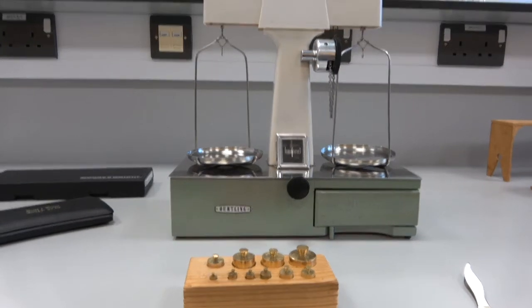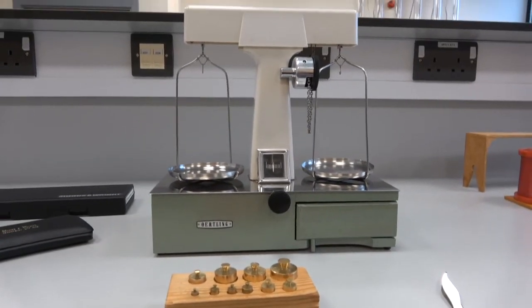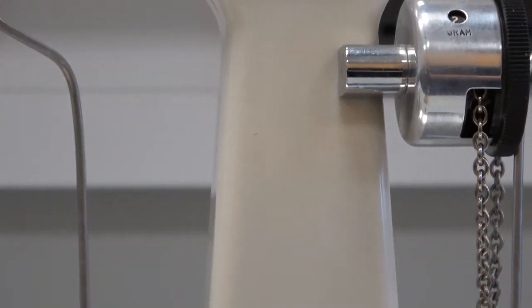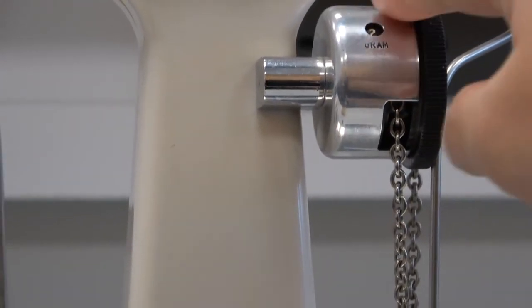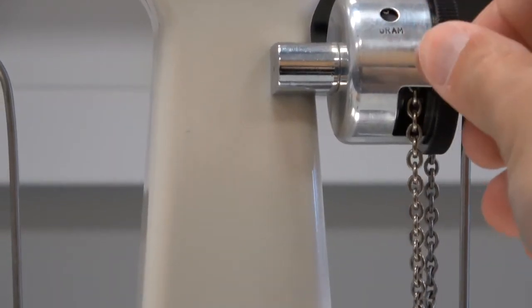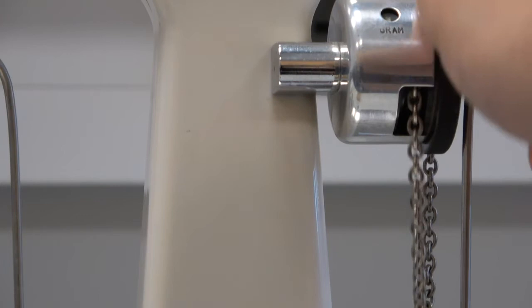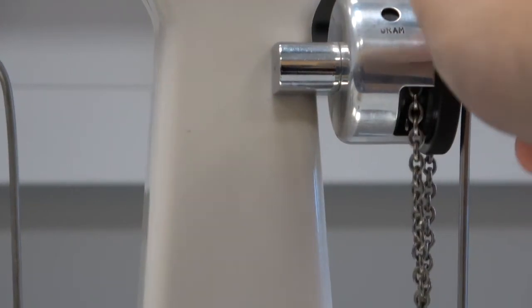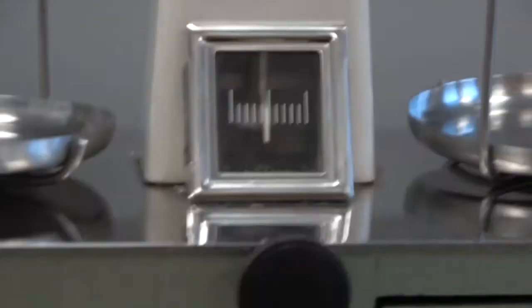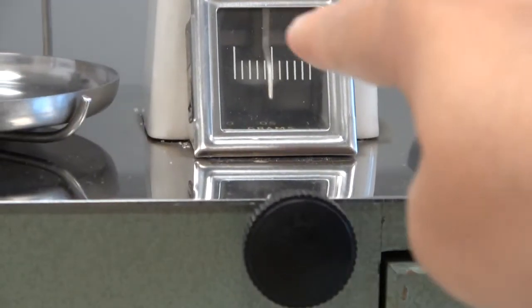Let's try a little fancy video magic here. So you can actually see, in this scale, you can see the increase in mass clicking up. Likewise, we also have a hundredths of a gram measurement on this.